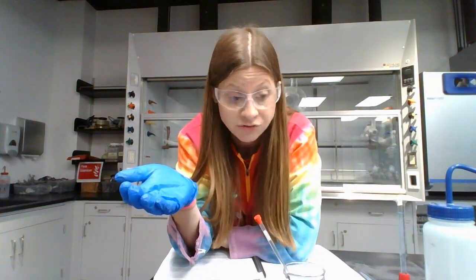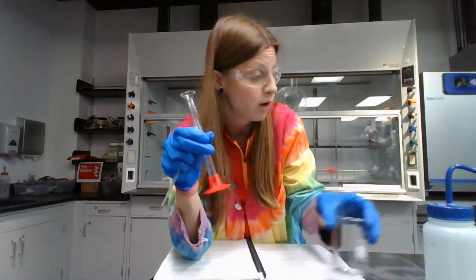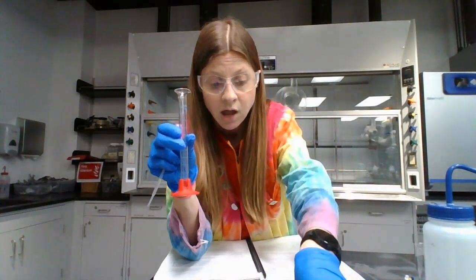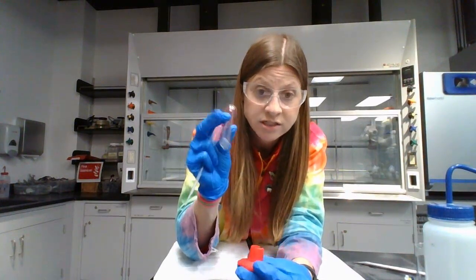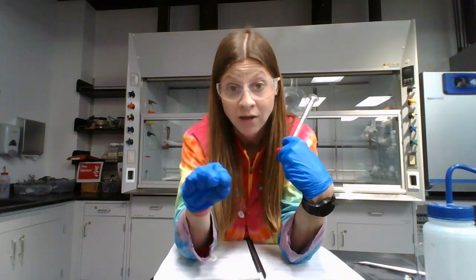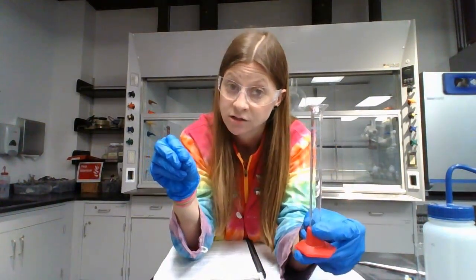Well, you have more to do in the lab anyway, and that is to determine the density of the Pedialyte or the chicken broth. So we're going to do that the old school way, which means we're going to take a 10 milliliter graduated cylinder, and we're going to use that to measure the volume, and we're also going to use that and the balance to measure the mass. So start with your 10 milliliter graduated cylinder completely dry, and go to the balance, close all the doors on the balance, click the tare button so the balance is at 0, and then place the graduated cylinder on the balance, close all the doors, and record the mass of the graduated cylinder.